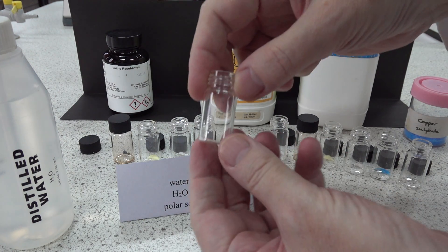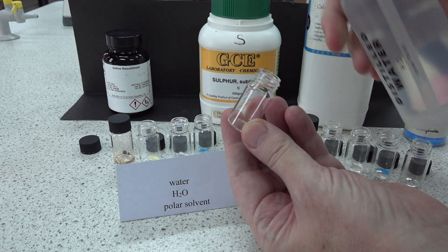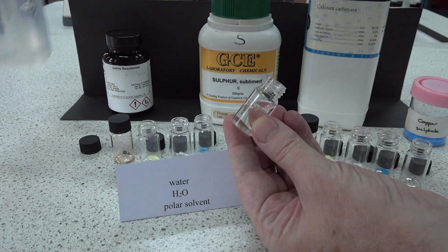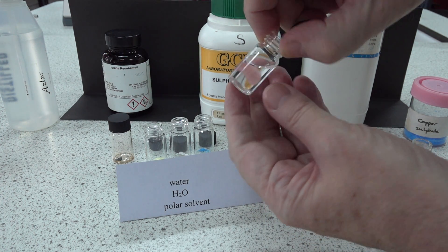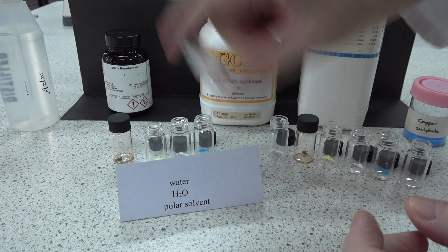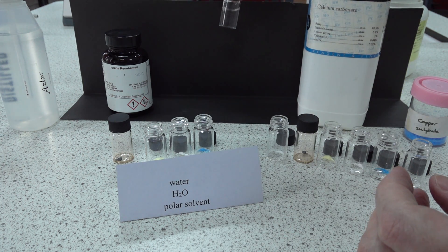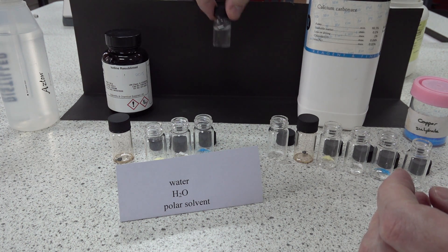Here's the tube with a small amount of sodium chloride. Let's see what happens when we introduce some water. The sodium chloride is already dissolving and disappearing. If we give it a shake, you can see that the solid has in fact gone - it's dissolved. So sodium chloride is soluble in water.